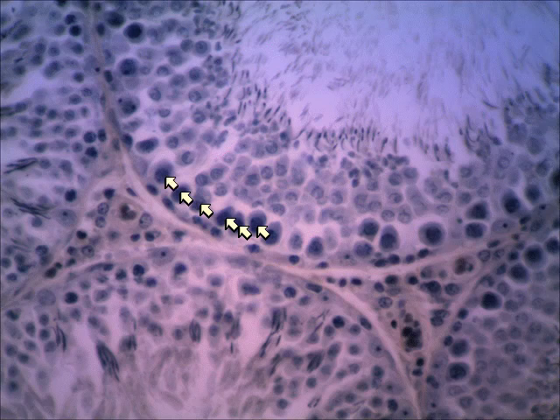And then the primary spermatocytes go through meiosis, and then you see several stages of meiotic cells until finally at the lumen you see the little nuclei or the heads of the sperm cells. So you can see those there. So these are immature sperm. You can almost see the flagella extending into the lumen from that.